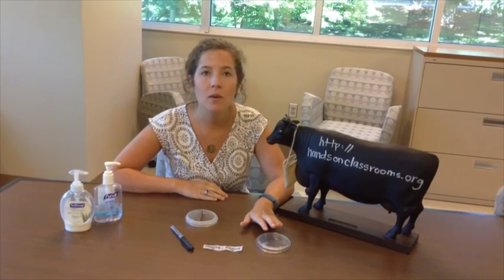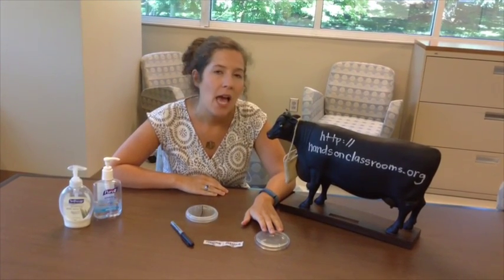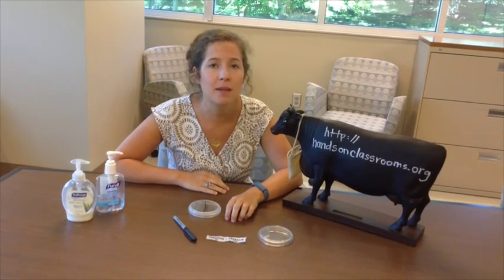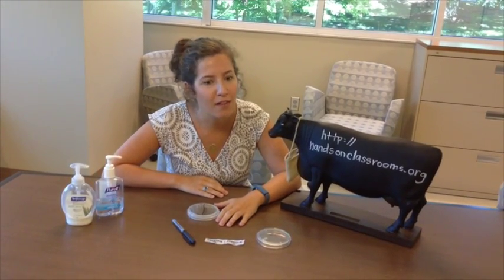In order to look at your agar plates, know that these are going to be a yellow-beige color. And if you happen to touch your plate — which you will during the experiment — it's going to feel like jello. Just think of it as if you're playing with your food at lunch.